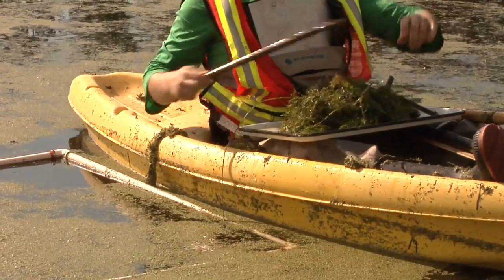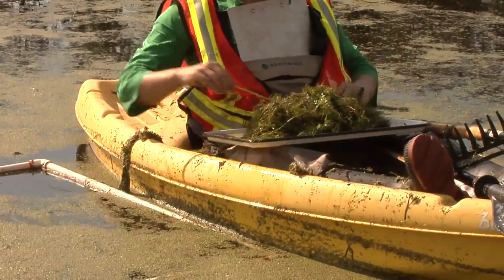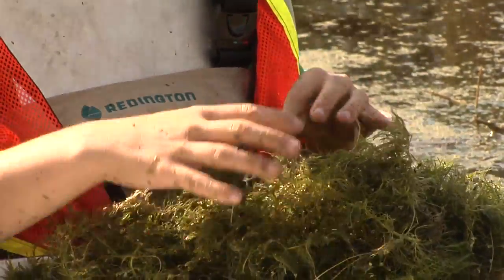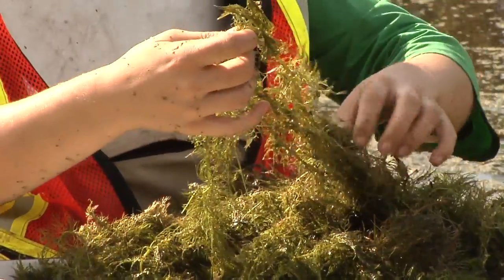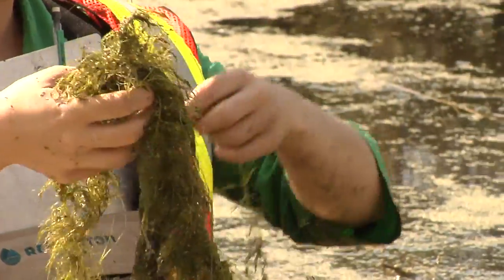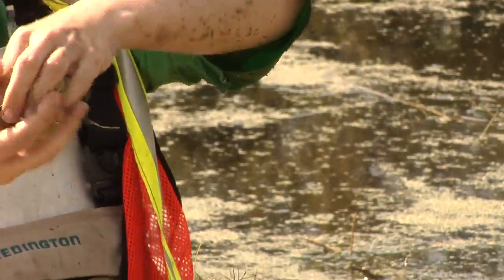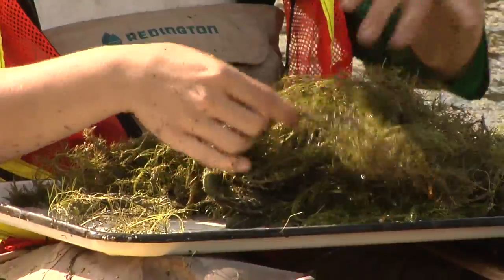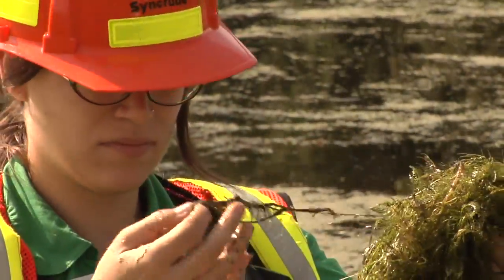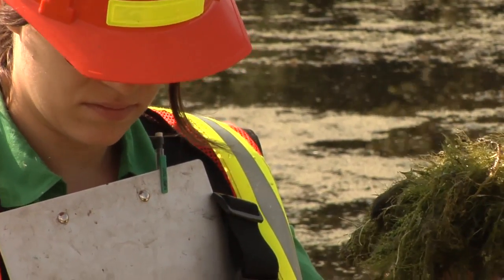So you can start by removing all the bits that aren't aquatic vegetation. So then you're going to want to sort it. And most of this looks to be Utricularia macrorrhiza, but there is Ceratophyllum demersum in here. So you're going to want to separate out the different species into different piles so that you can estimate their relative biovolume. As with wet meadow zone plants, voucher specimens can be taken for any hard-to-identify species.